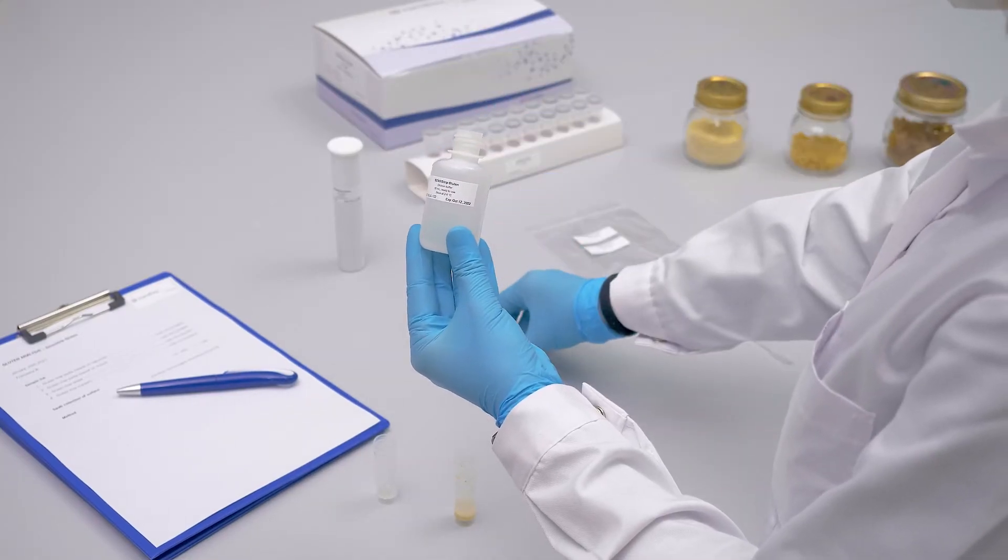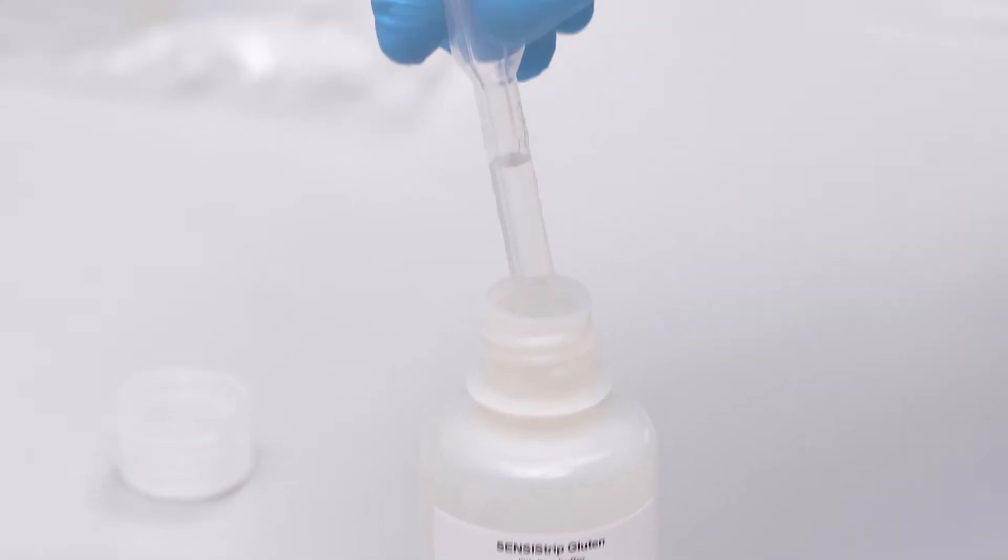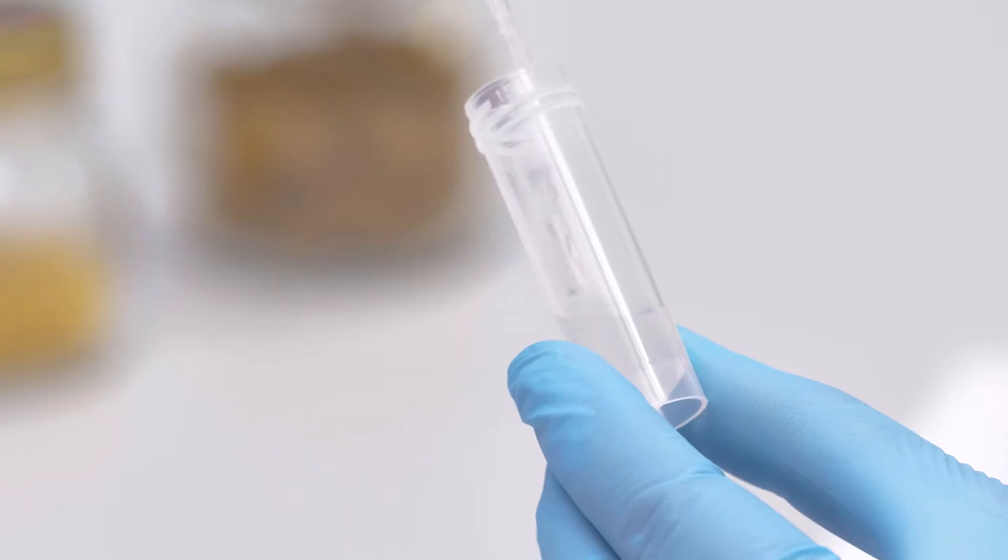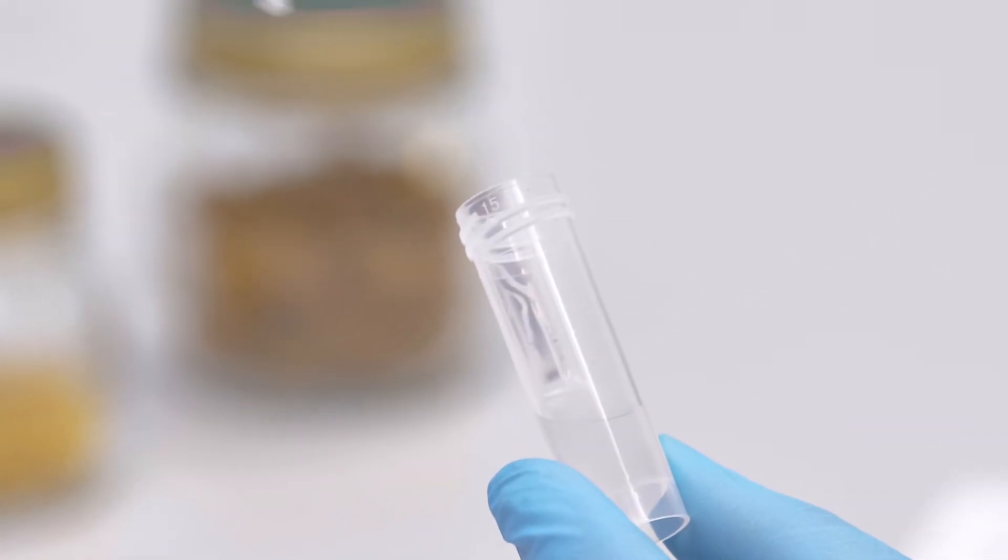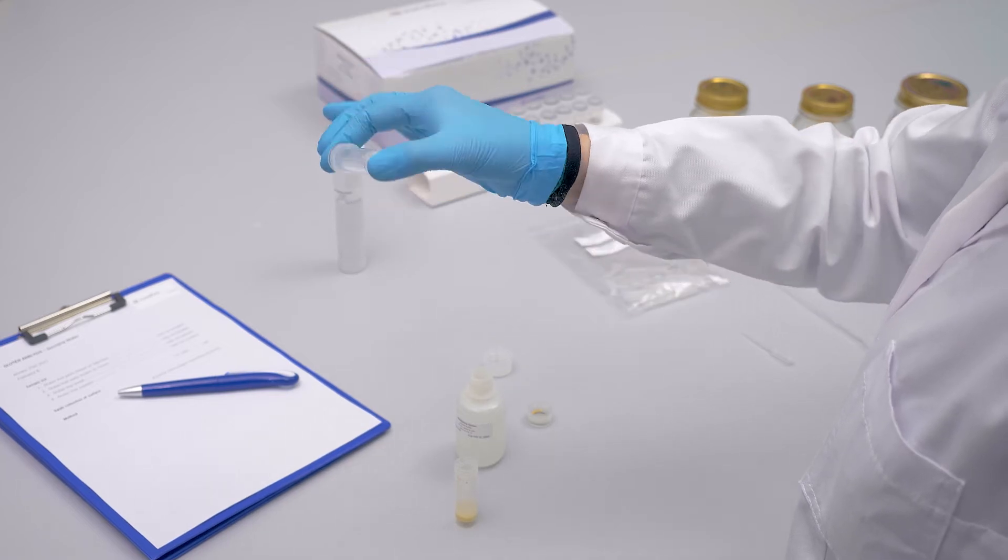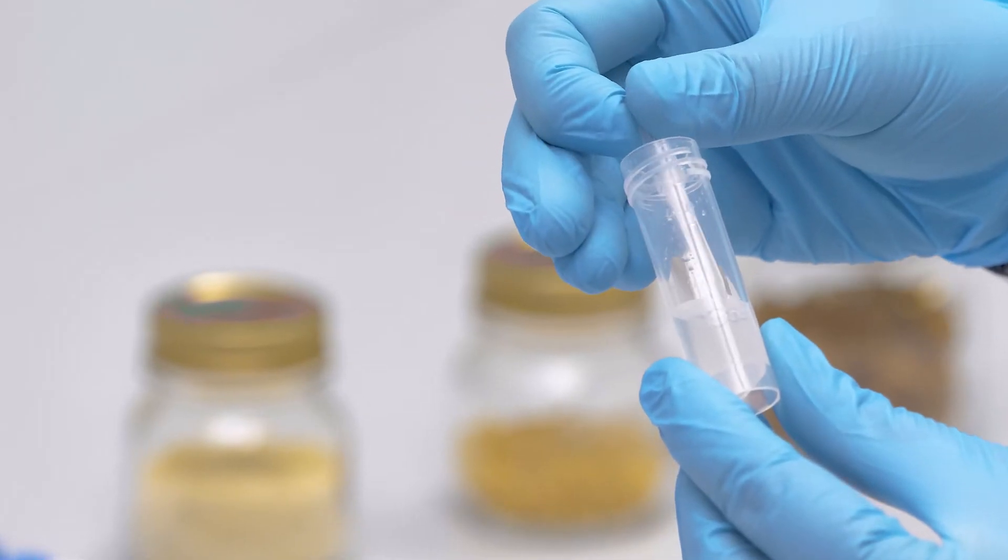Dilute with 3 milliliters of dilution buffer using the second 3 milliliters pipette available and shake for one minute. Collect 300 microliters and transfer to the reaction tube.